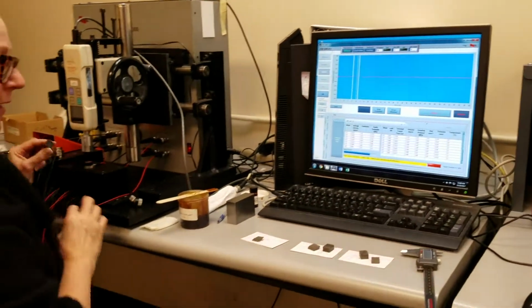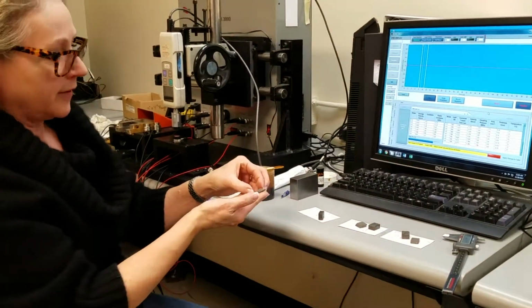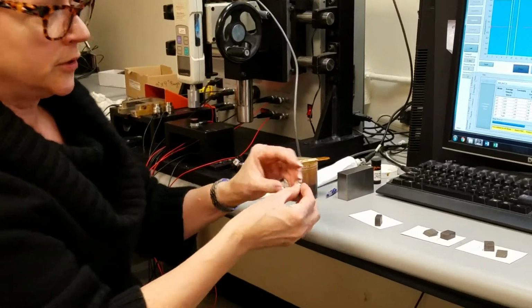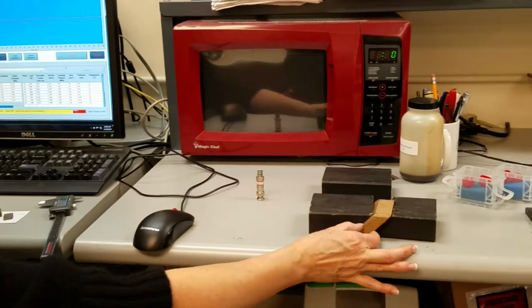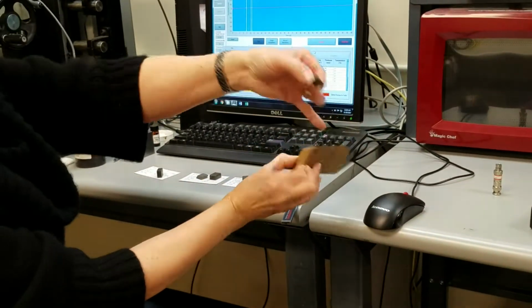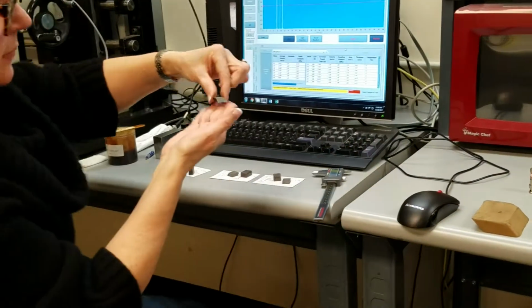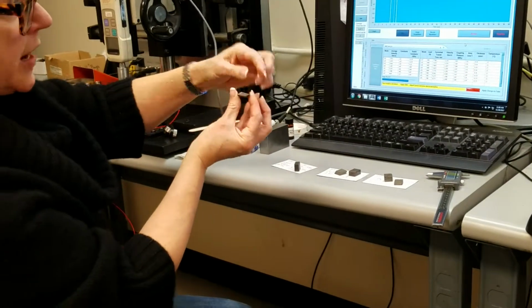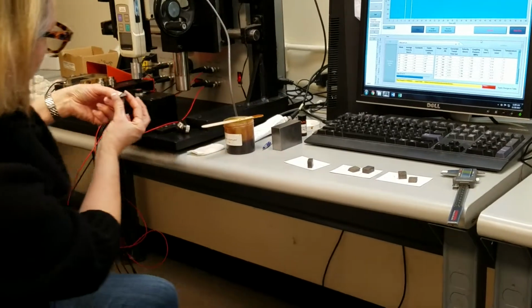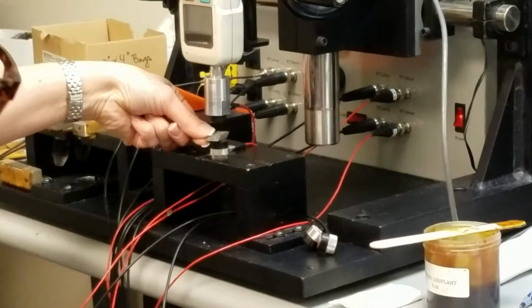I remove my rectangular sample and pick up the 45. Now, as you may recall, with my block sample over here, I want to be measuring through this dimension here. So with our cut sample, it's a little bit small, but the side view, so that the stems are going to be parallel, looking at like a parallelogram.